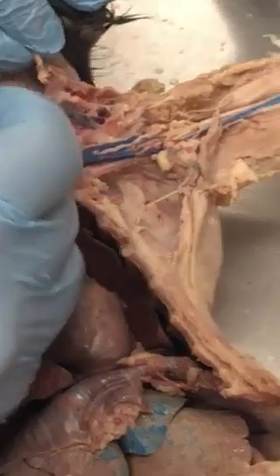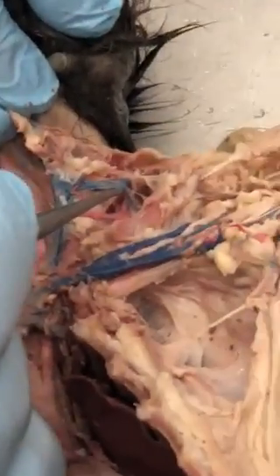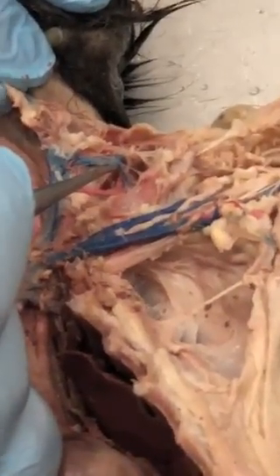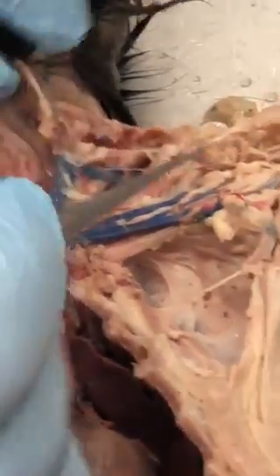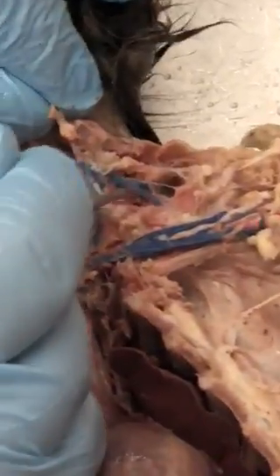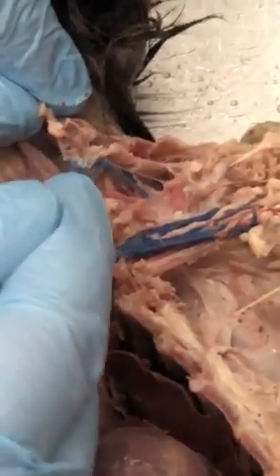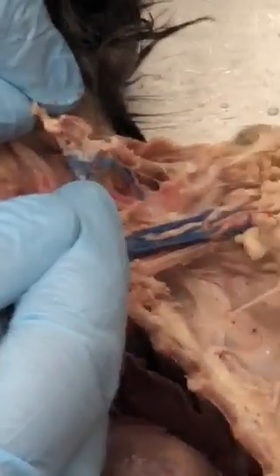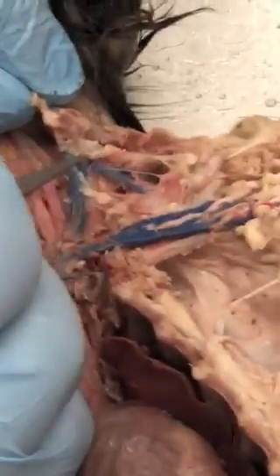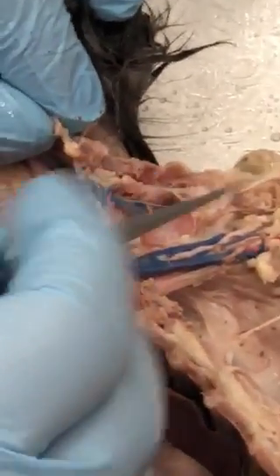Coming off of the external right there, that is called the transverse scapular. You see it branched there, but just right where the first branch is — that's the transverse scapular.